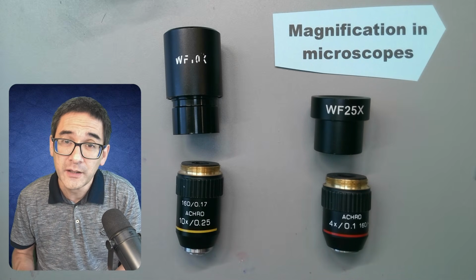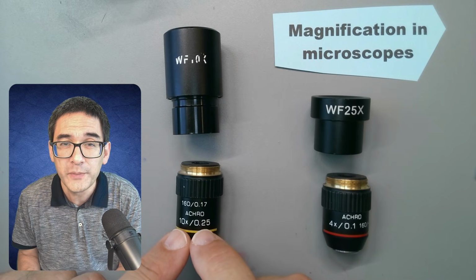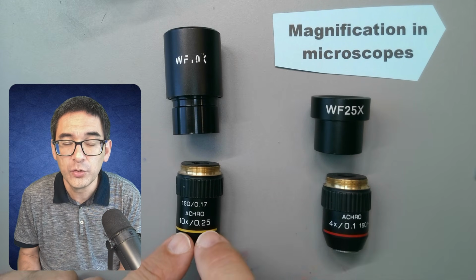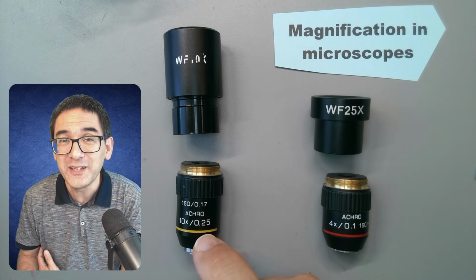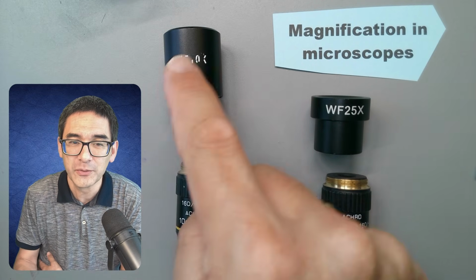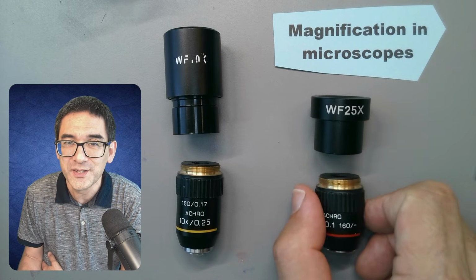Now, you can actually see a number over here, the 0.25. That's the so-called numerical aperture. And over here it's only 0.1, and the numerical aperture tells you something about the resolution, about the clarity of the image, and the higher the value, the more details you're able to see. So because this one is 0.25, you're able to see more details with this combination than with this combination, even though the magnification is the same.